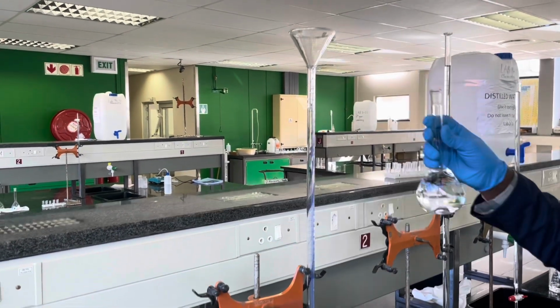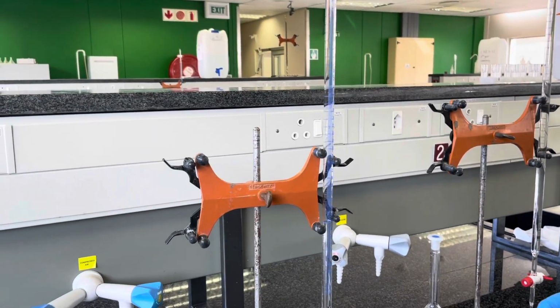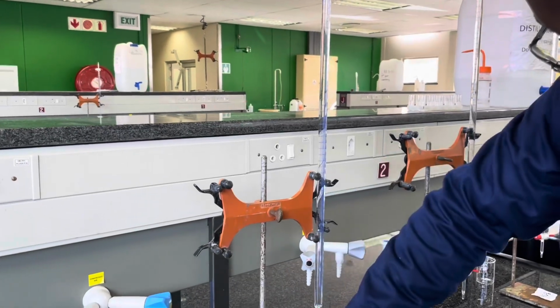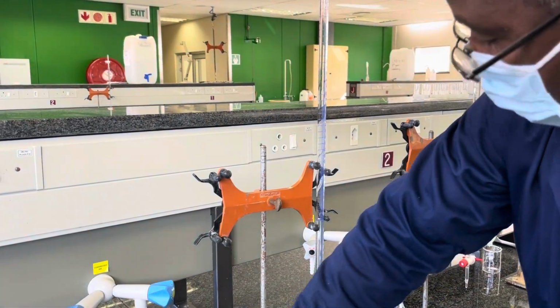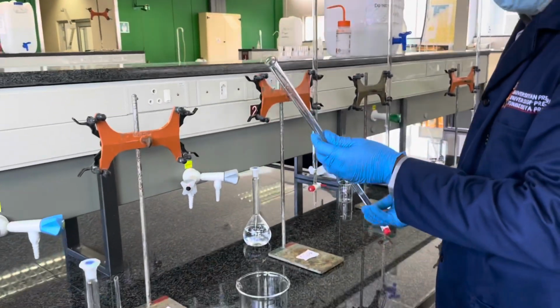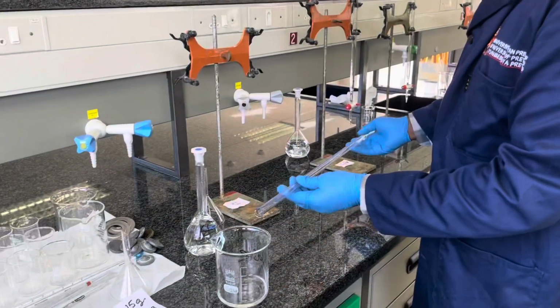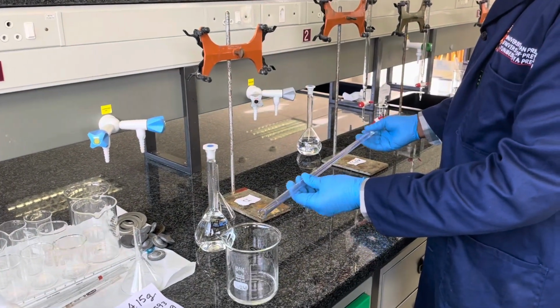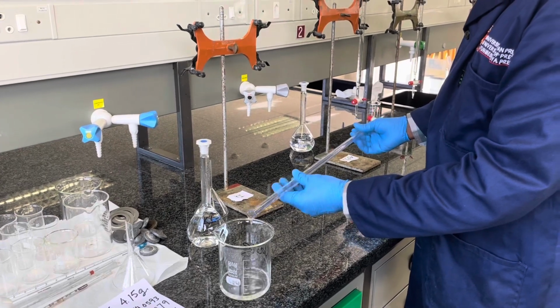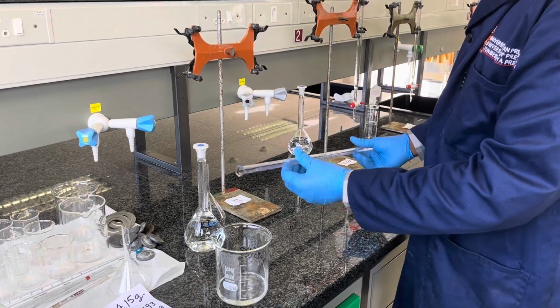The rinsing ensures that your Buret is cleaned with the solution you will be using for dispensing. First, start by dispensing out through the top part of the Buret. Turn the Buret horizontally, twist it by running the solution downwards and allowing some of the solution to run out at the top.